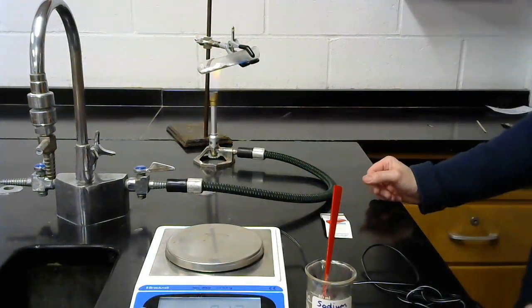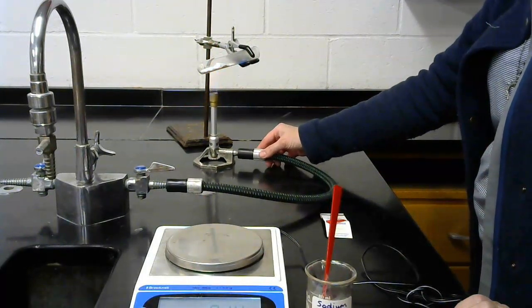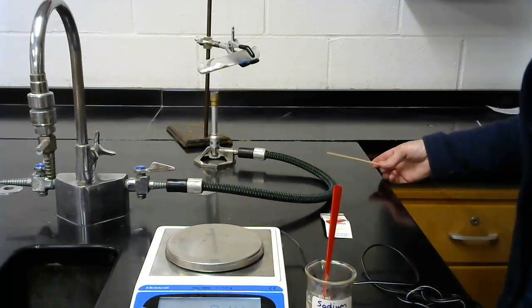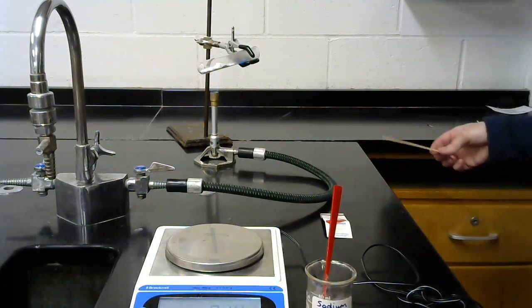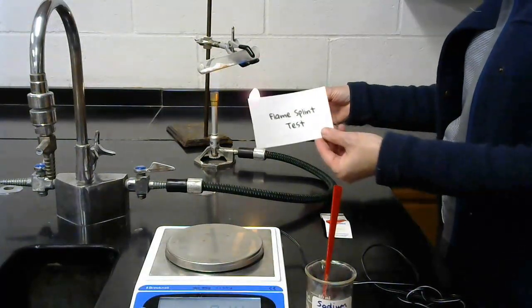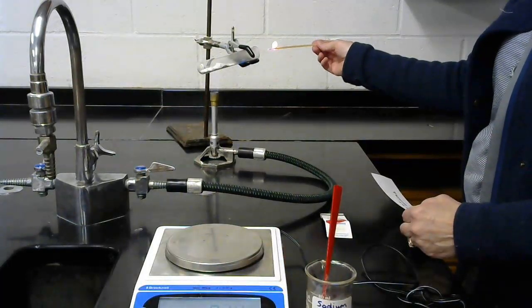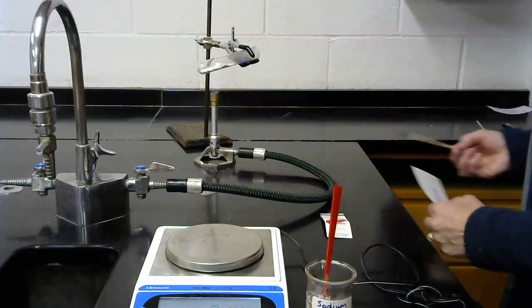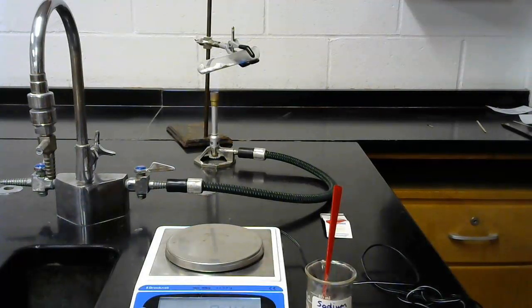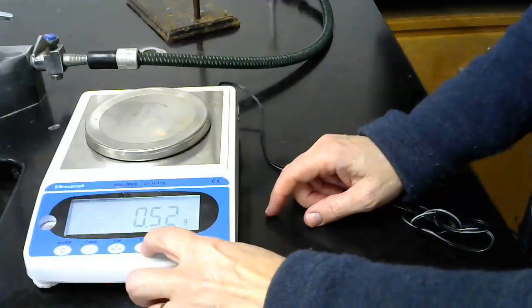Spread the substance out a little bit more so it heats a little bit faster. It will take quite a while for this reaction to go to completion.